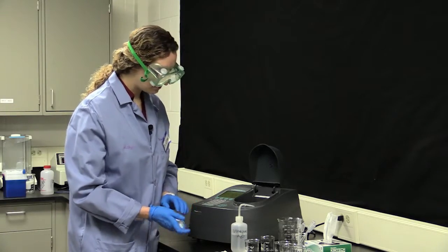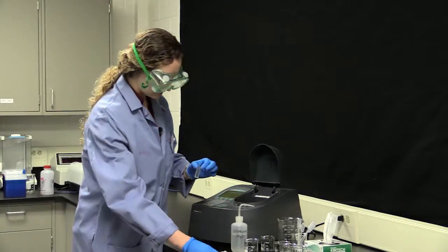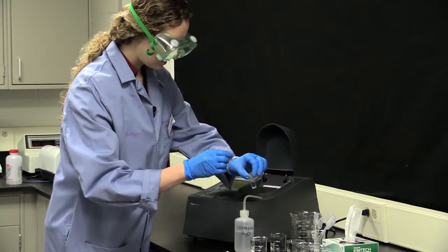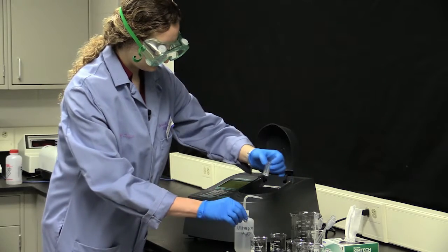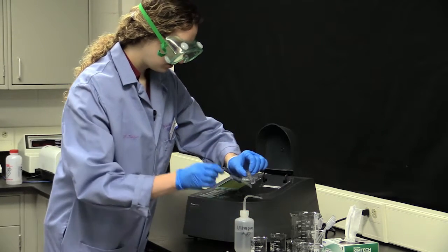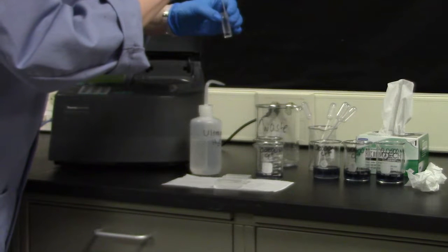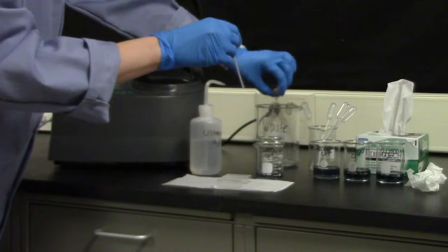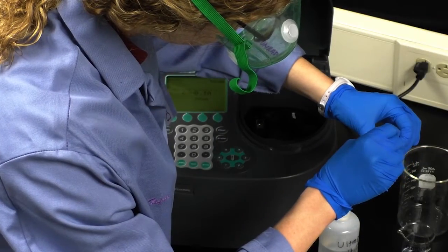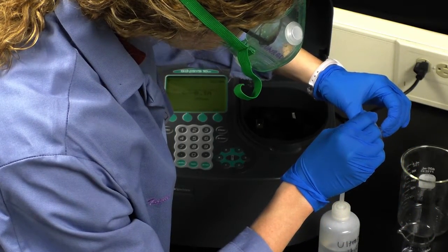The next thing you're going to want to do is input your 0.02 molar chromium solution. I will again select a cuvette, and this time I'll use a pipette. I'm going to rinse off my cuvette again, using my pipette to rinse off the sides. I did it 3 times, and now I'm going to fill it, just like I did for the water. When filling, you also want to make sure you get rid of any air bubbles, because that can cause a problem when you're trying to collect your spectra.